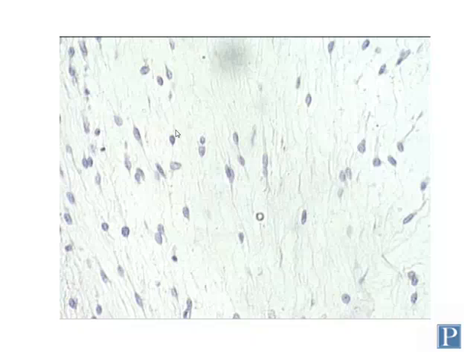The particular slide where you find the mesenchyme will have other tissues that have already developed, or these cells have differentiated already into some other tissues. So you're going to have to look to find this among other tissues. And mesenchyme tends to be one of the most unremarkable parts of the slide.